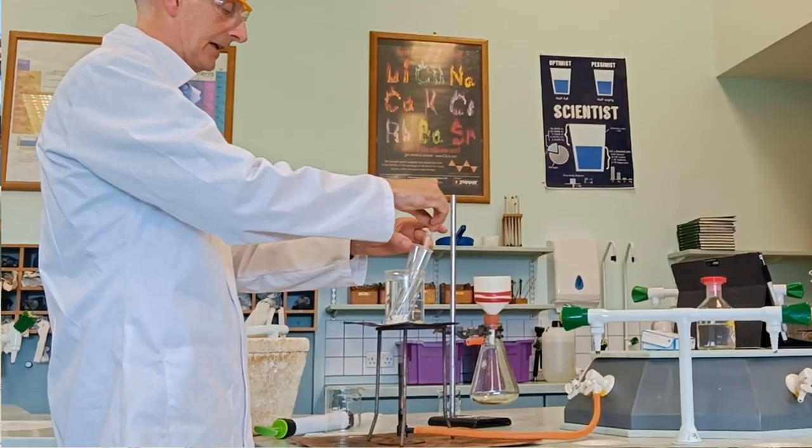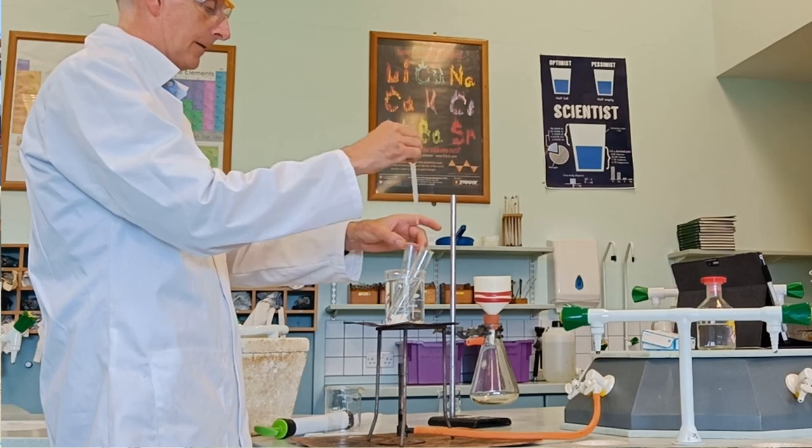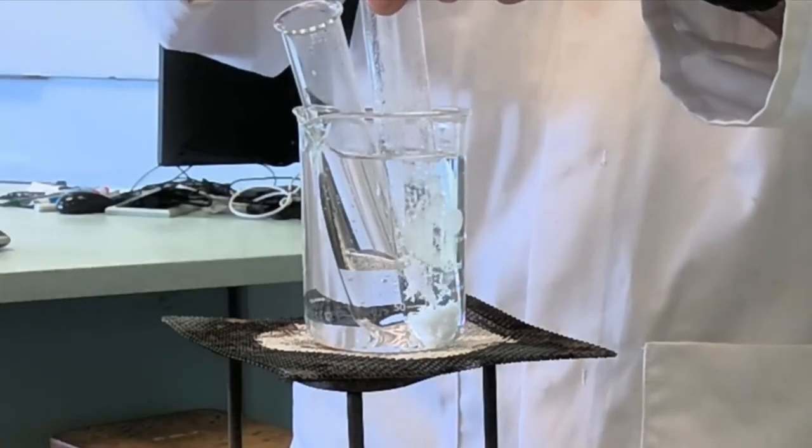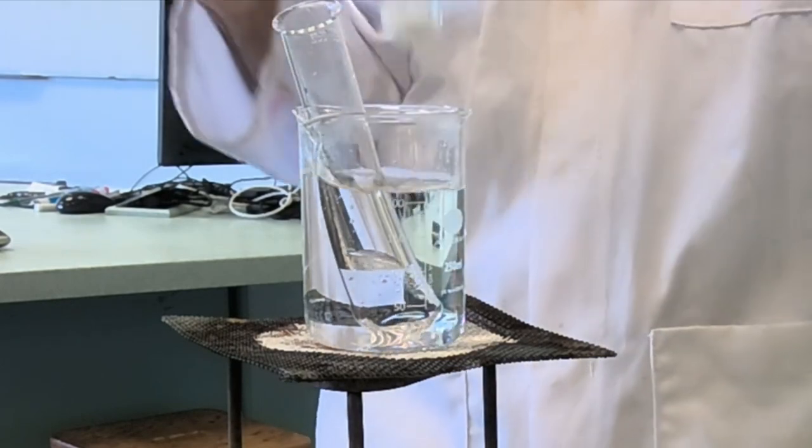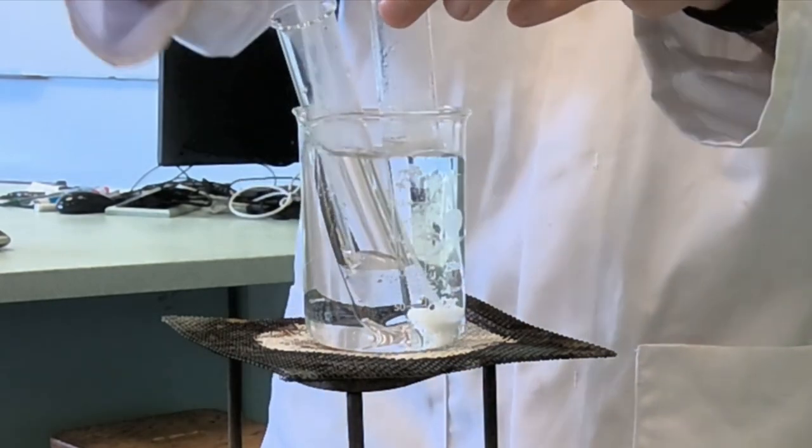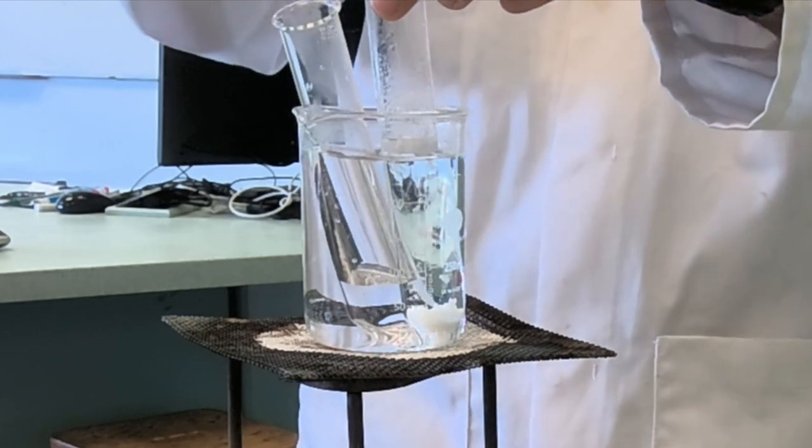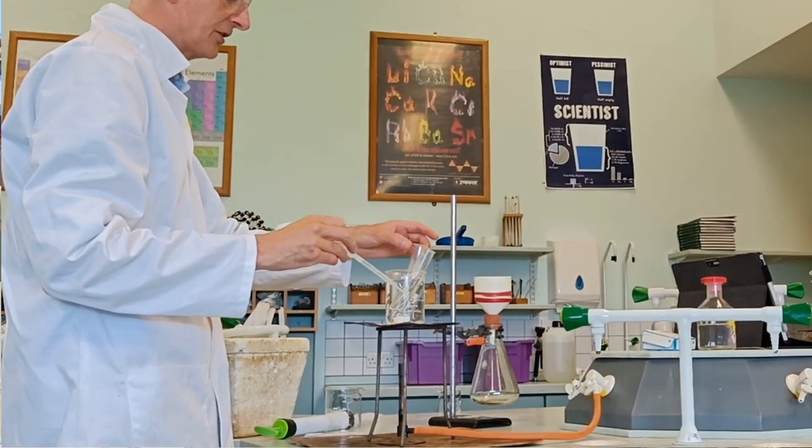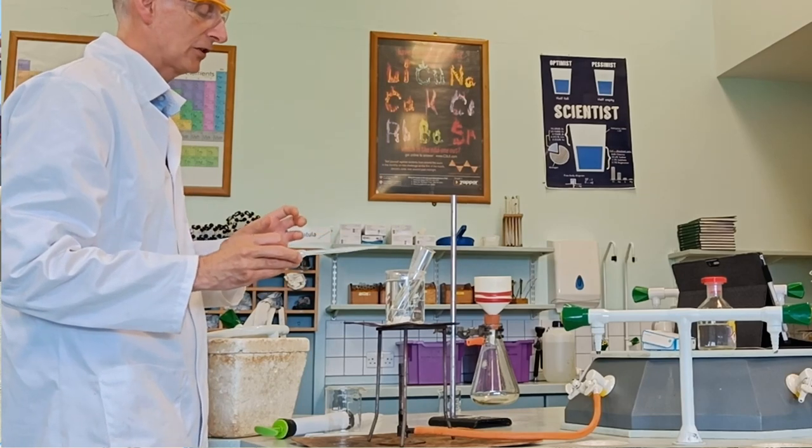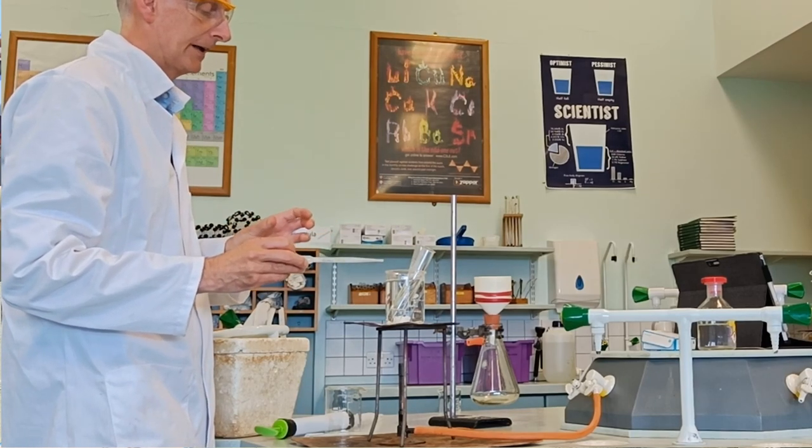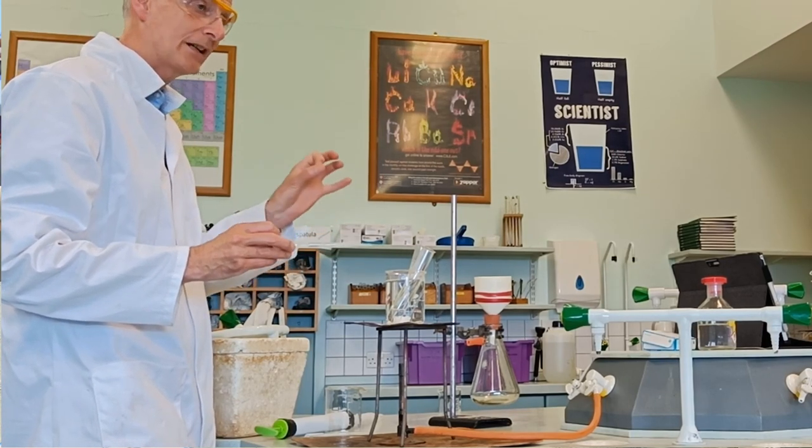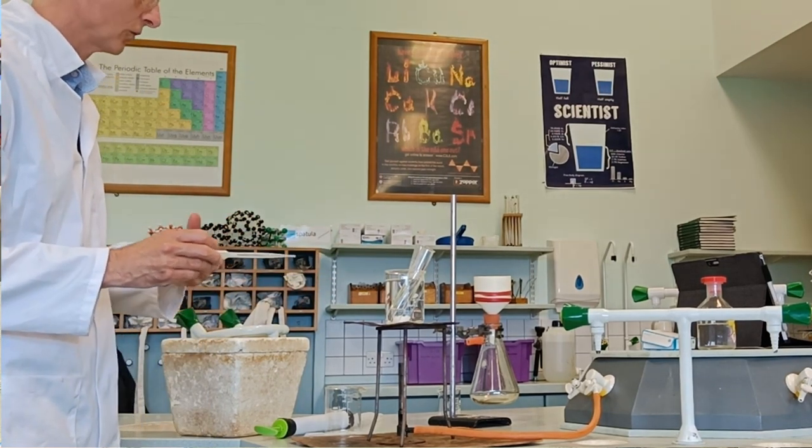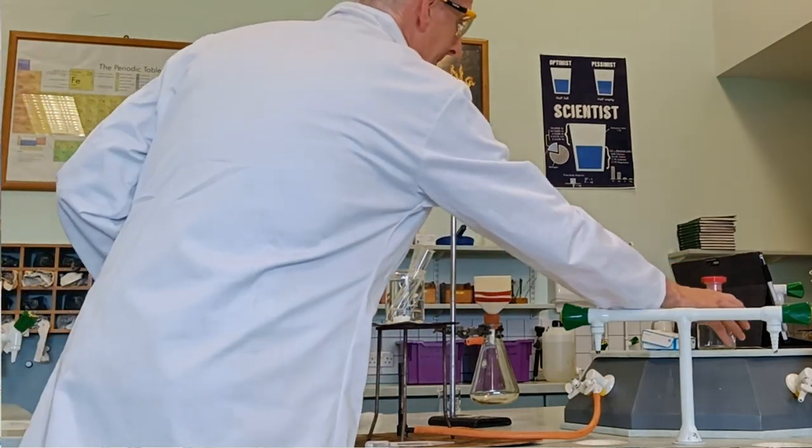Still not going. I'm running out of my lovely hot solvent here and it's not quite gone yet. It still looks like a snowstorm. I'm reaching the dregs here. This is a little trick - benzoic acid isn't terribly soluble in water, but you can tweak the solvent a bit and give it something it's more soluble in.